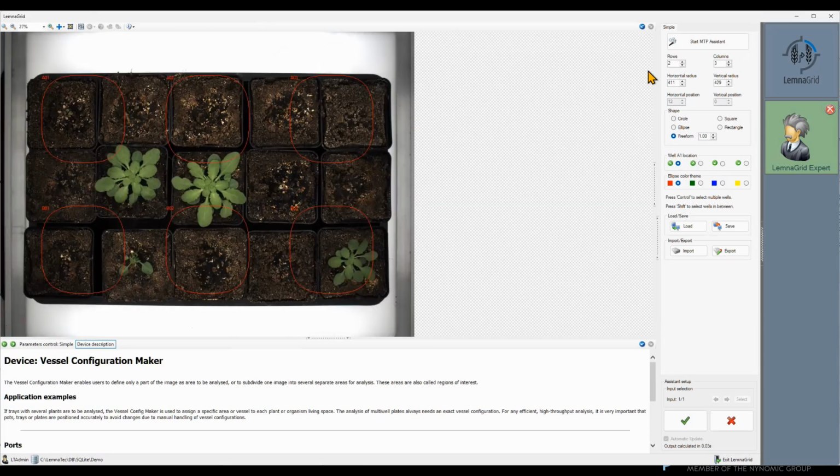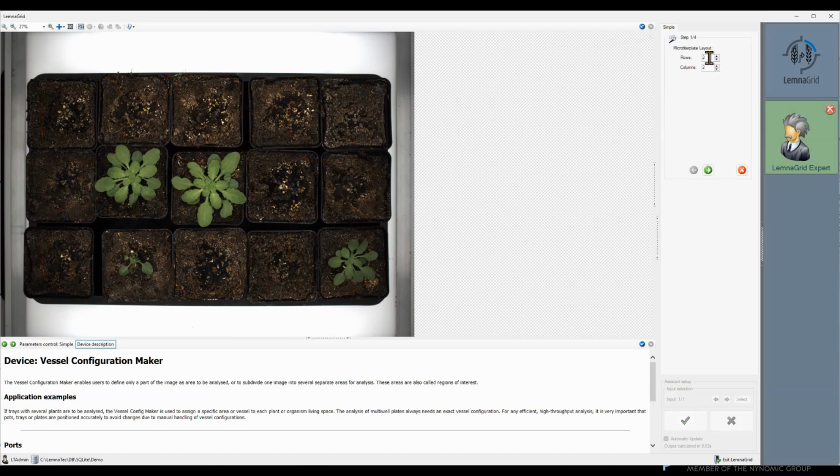By default, we have 6 positions in a 2x3 layout. However, we can change it. The best way to do it is using the MTP assistant. We have 3 rows with 5 plants in our image. Now we place the top left region of interest over the respective pot.